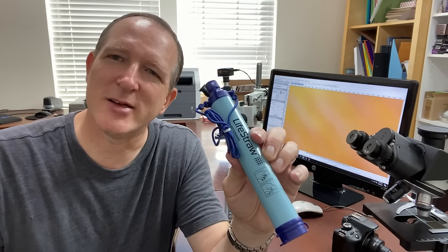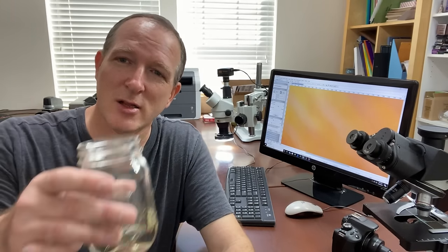Isn't it amazing how you can take dirty pond water with all those microorganisms in them, filter them out and get clean drinkable water with something like this. Now this is not a paid advertisement. I'm not getting compensated in any way. And there are other manufacturers out there that also make filters such as this. But I think I'm going to have to do one last test here to prove that this is clean water. And you know what that is.